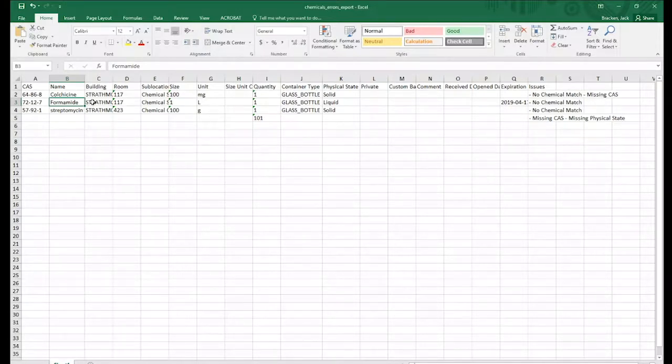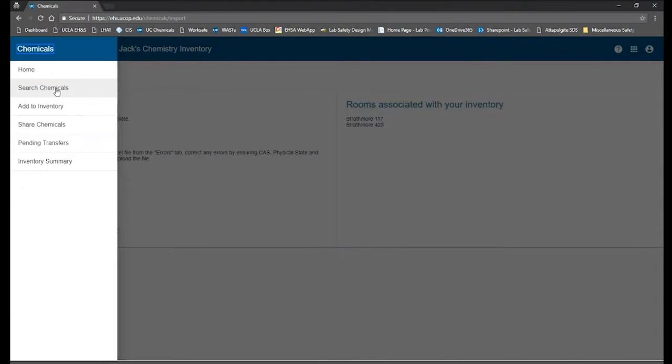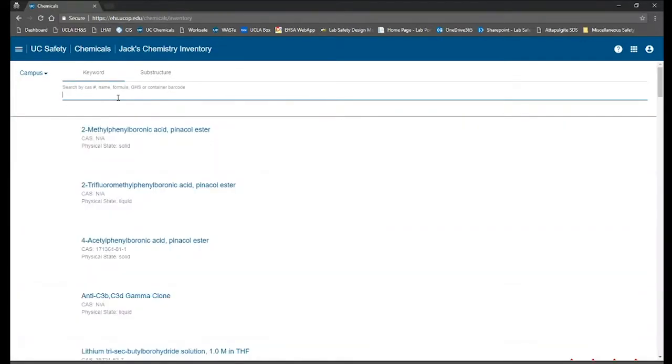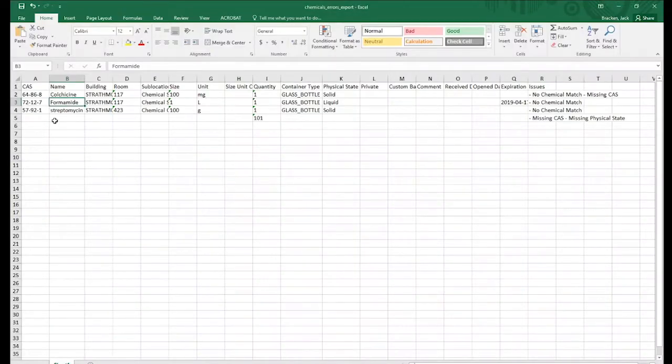Another way I can check is to go back to UC Chemicals, open the sidebar here, go to Search Chemicals, and we want to actually look throughout the whole campus. So I'm going to select campus. I'm going to type the word formamide, and what shows up but the CAS number that I need. I'm going to go back to the spreadsheet, correct the wrong CAS number with the correct one I just found.